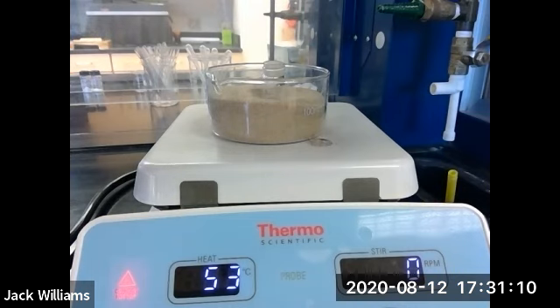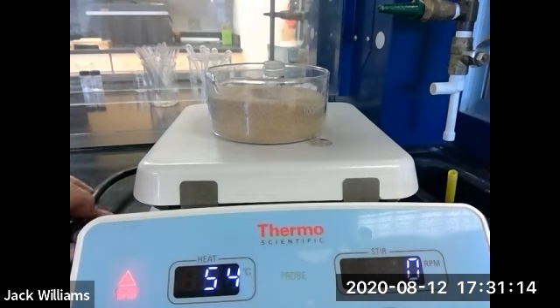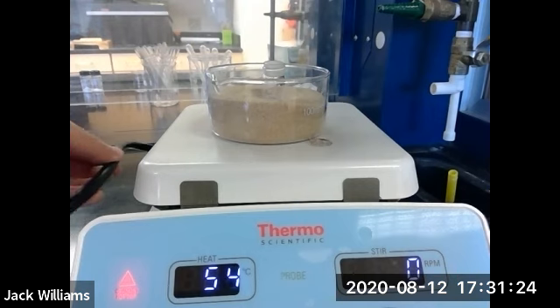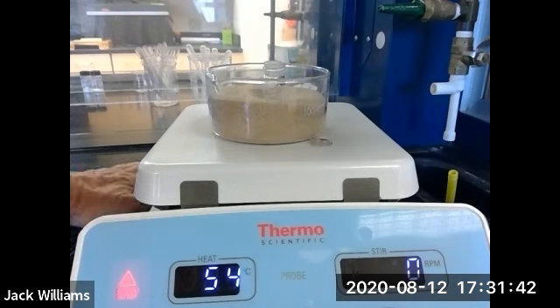Cool. Now this is important. Look at the cord. Make sure that cord does not touch the hot plate. That's a big problem. If you look at this cord, you will see there's all sorts of etching where students have accidentally had this touching. I know it's only 50 degrees, but we have experiments where you set the temperature for 250 degrees. At 250 degrees, if this touches the hot plate, it's going to start to melt. If it melts, we're going to have a short. So that's the only thing you have to be careful of using a hot plate. Make sure this is down and not touching any of the sides.